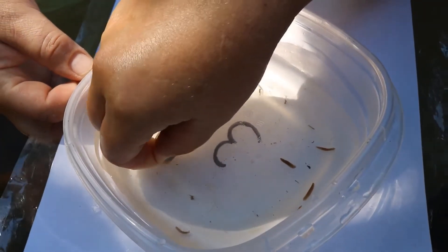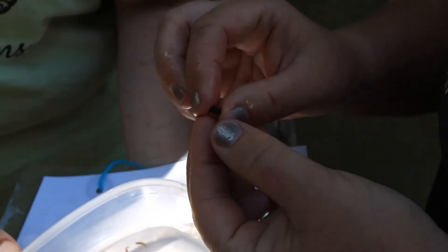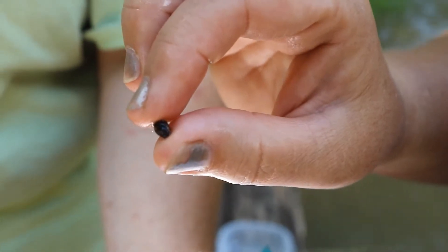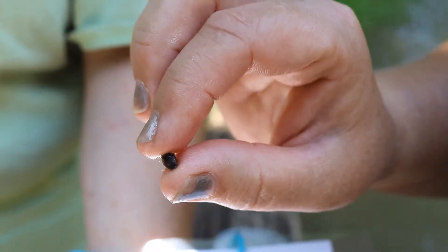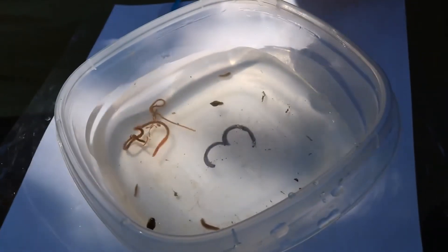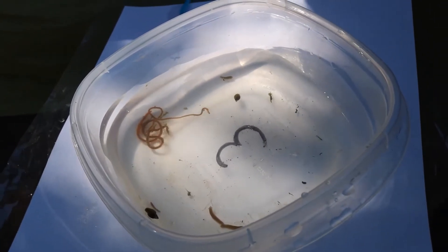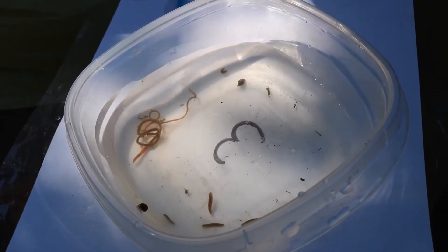You'll find snails in a couple of different groups because there are two different kinds. If you hold this one up with the point up, you can see the opening is on the left — so this is a pouch snail, one that is very tolerant to living in polluted water. If the opening was on the right, it would need a cleaner environment. So if we only found these organisms, you'd probably want to look into what we can do to help that environment because it is very polluted.